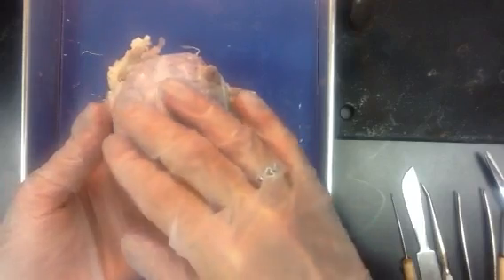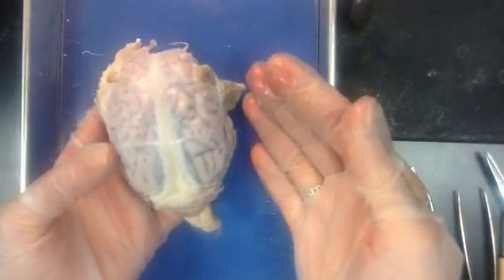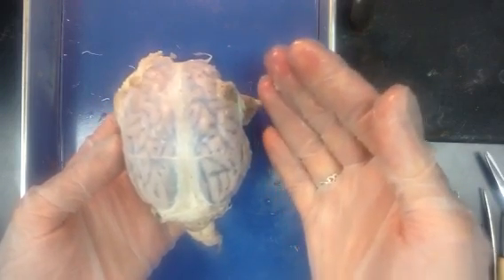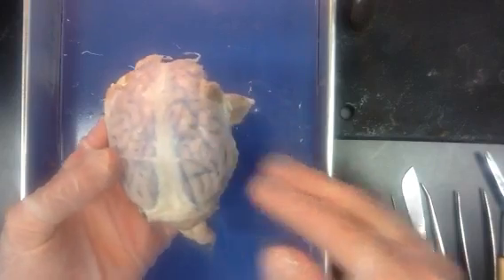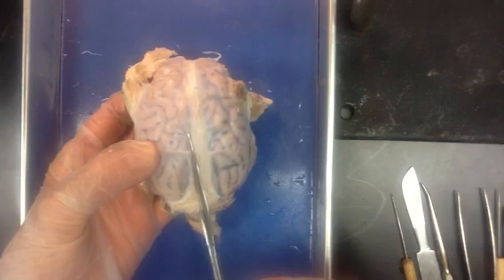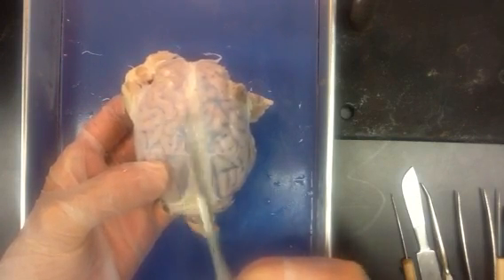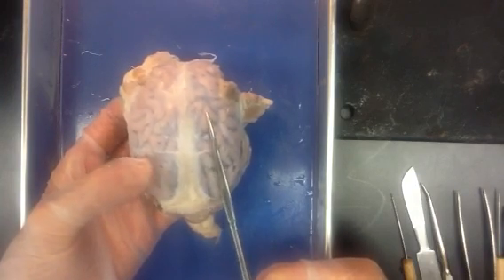On the outside, we'll see a whitish material. If it's white, hopefully you'll remember what type of tissue it is — dense, regular connective tissue, much like tendons. This outer layer, very much like a knight in shining armor, is the most durable and toughest outermost layer of three important protective layers or membranes on the central nervous system. These are called meninges.